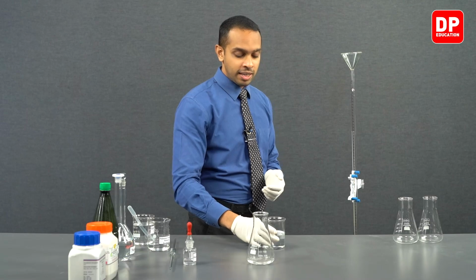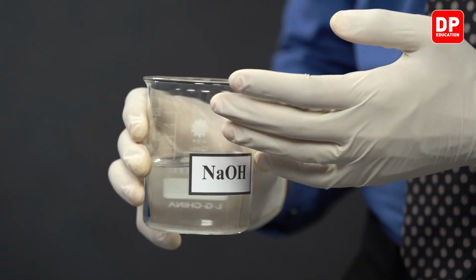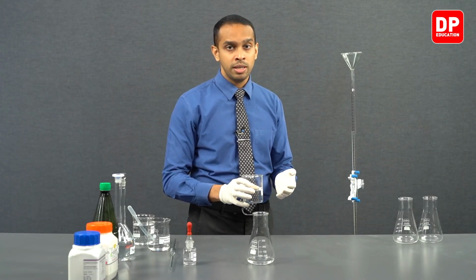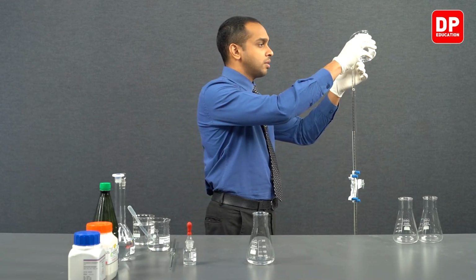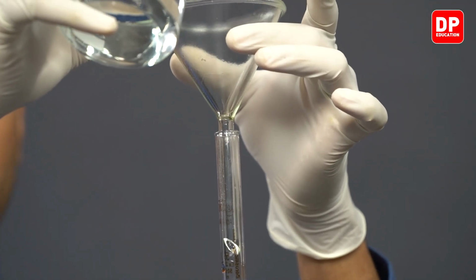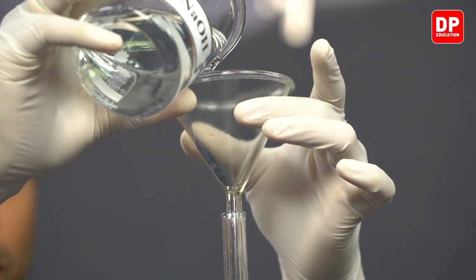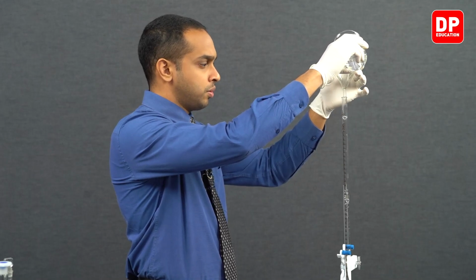So we can easily take our sodium hydroxide, which is going to be our titrant in this experiment, because we do not know the concentration of sodium hydroxide that accurately. So we will take sodium hydroxide, and as we fill sodium hydroxide into the burette, we are going to lift the funnel a little bit so that it leaves enough room for air to escape. We will fill it all the way up to the top.